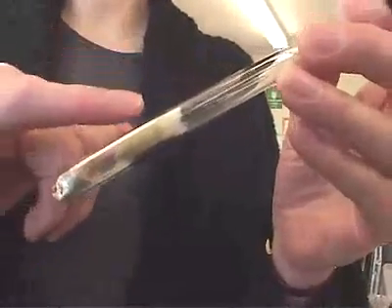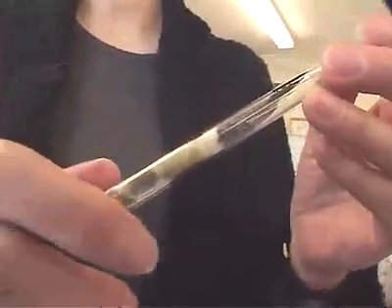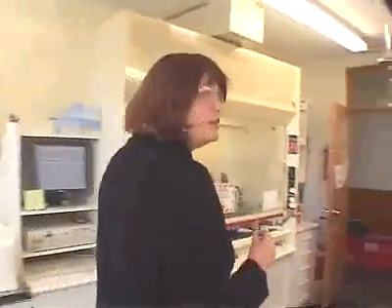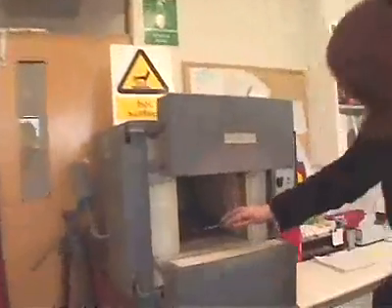In combustion, we place the dried sample in a quartz tube with copper oxide and silver wire, and then we evacuate it so that it's a vacuum inside, and then it's flame sealed off to create a tube with a vacuum on the inside. Then that tube is placed into a muffle furnace, and in the muffle furnace the sample is heated to 900 degrees overnight, and the solid sample then burns in the oxygen, producing carbon dioxide, water, and then sometimes some other non-condensable gases.